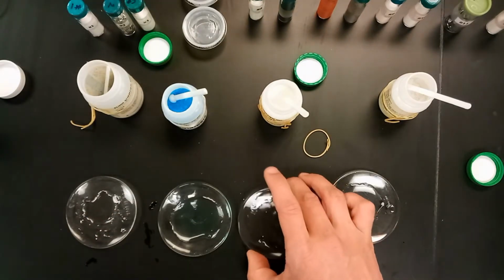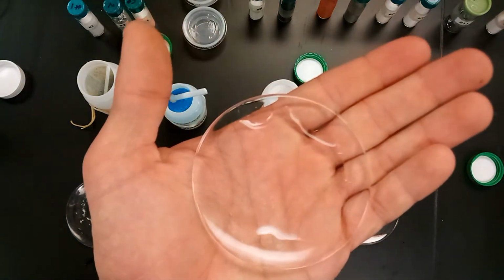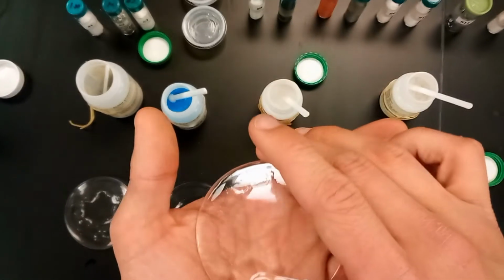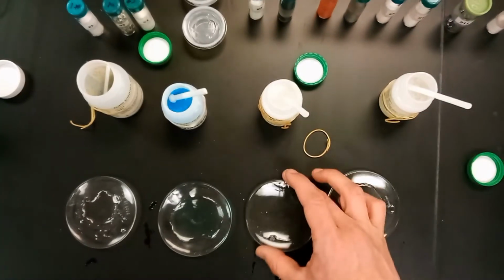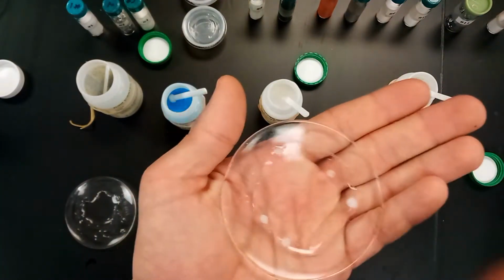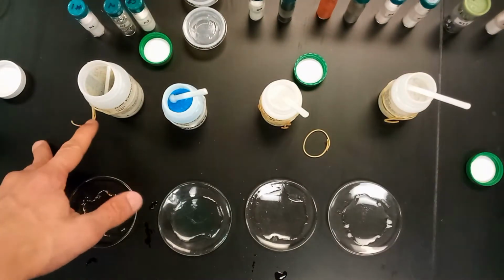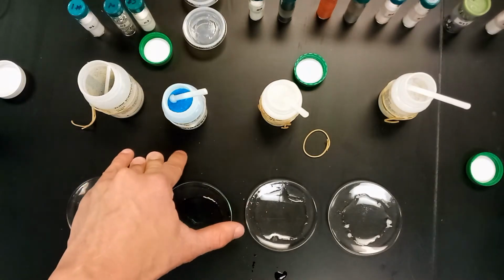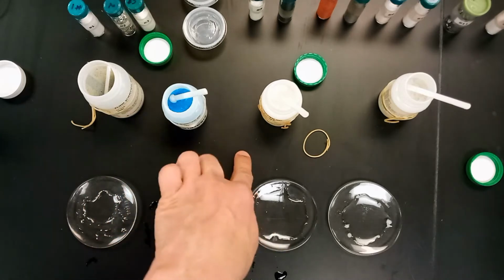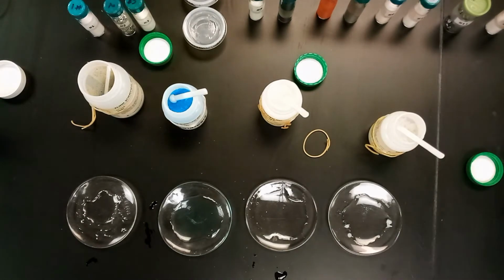Next one we've got here is dextrose. Again, as you can see, it kind of just looks like water because sugar is soluble in water. So there's that one. And here with paraffin wax, you have the beads just floating on top of the water, as you'd expect. So remember that zinc represents metallic bonding, copper sulfate represents ionic bonding, dextrose represents polar covalent bonding, and paraffin wax represents nonpolar covalent bonding.